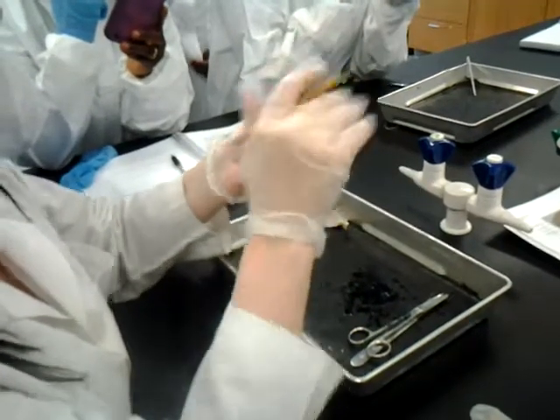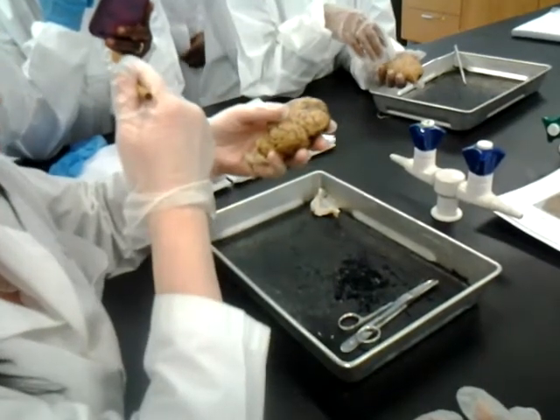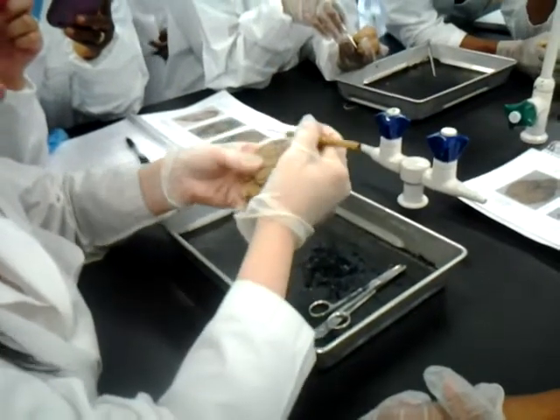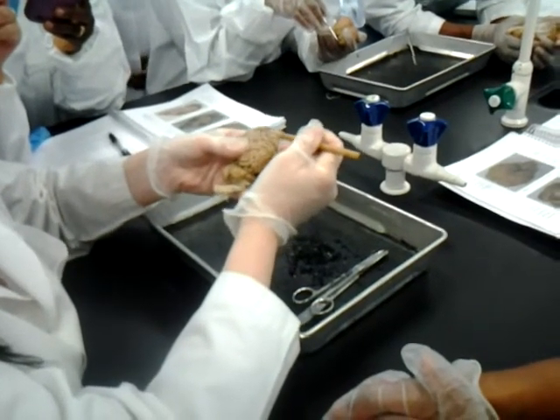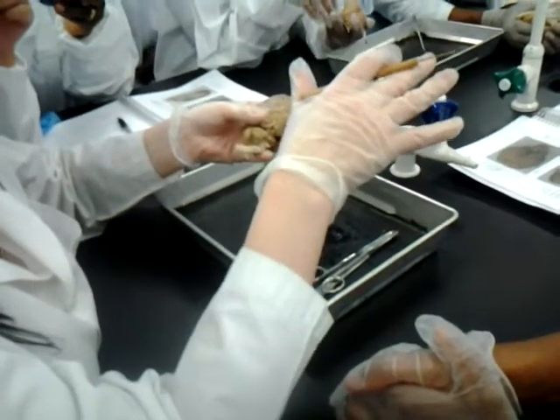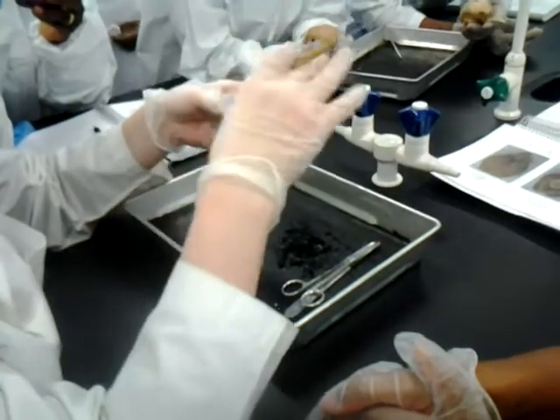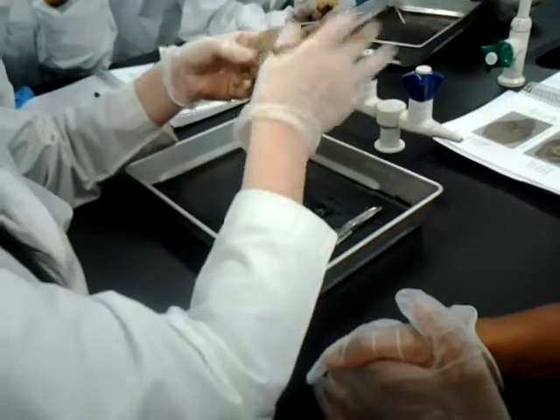Okay. Now, there are things you had to know in the plastic model that you do not need to know in the sheep brain. You don't have to know the lateral sulcus. You don't have to know the insula. You don't have to know or find the central sulcus or the pre or post central gyri. It's a little too difficult. You might not be positive. So instead, those will stick on the plastic, not on this. Now, back to what you do have to know. You have to know the basic lobes, besides insula, because we're not going to cut into it, and the functions.